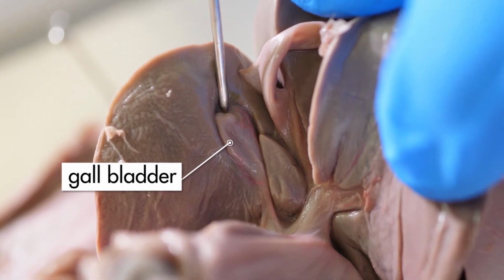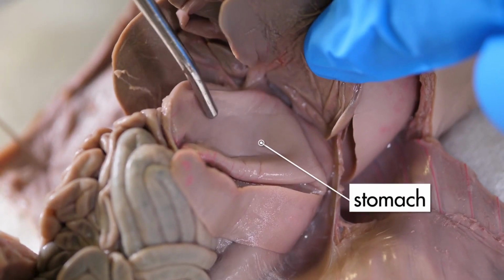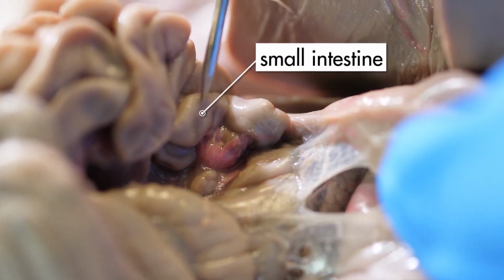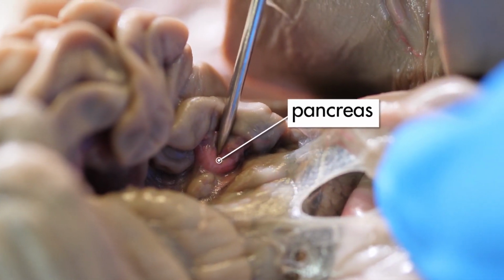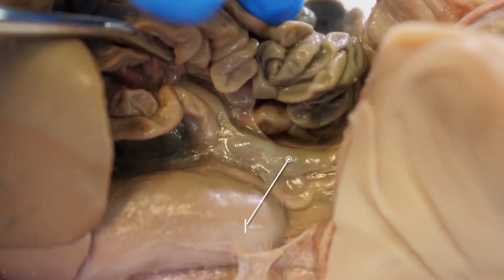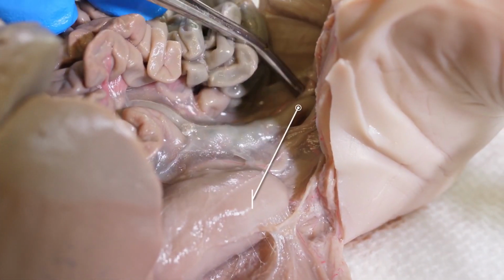Beneath the liver is the gallbladder. When we lift up the left lobes of the liver, we see the stomach. A pig has a one-chambered stomach, which performs both mechanical digestion and chemical digestion. Since a fetal pig has never used its stomach, the stomach is rather flat. The stomach connects to the small intestine. In the first curve of the small intestine, we can see the pancreas, which is a gland that aids in digestion and other metabolic processes. The small intestine winds around in the abdominal cavity until it connects to the large intestine. The large intestine ends at the rectum.